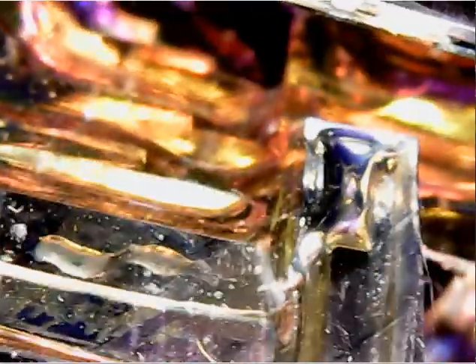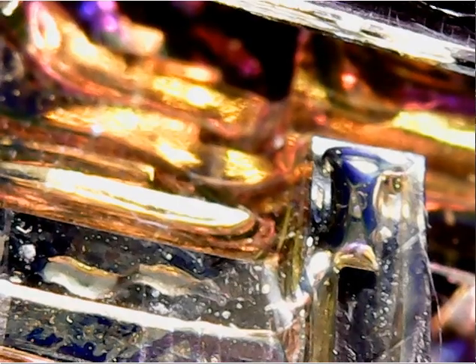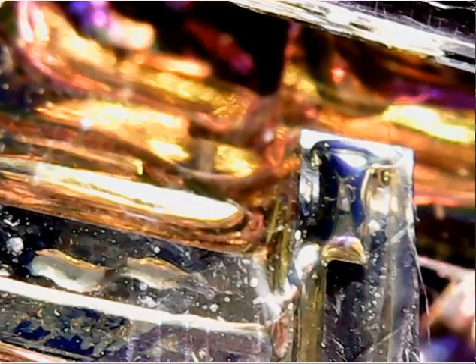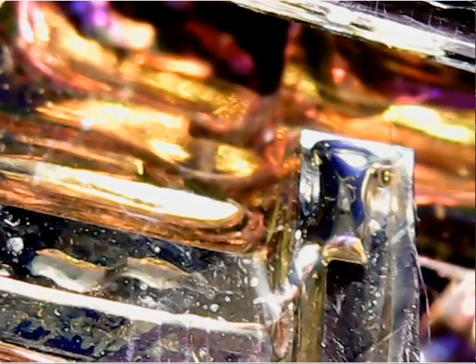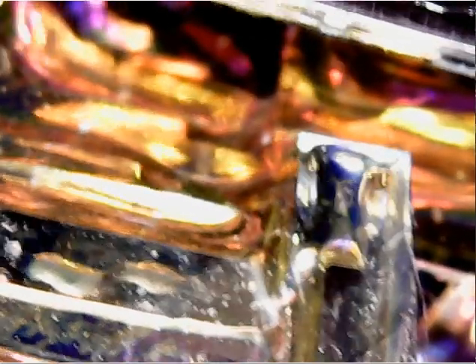Let me zoom in a bit. Let's hope I don't come into contact with it. I took off the lens cap, which normally you don't, but I had to because it looks fine normally. But when you're going in on a 3D object, it actually focuses on the lens cap rather than the object.